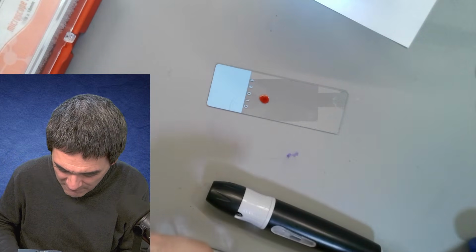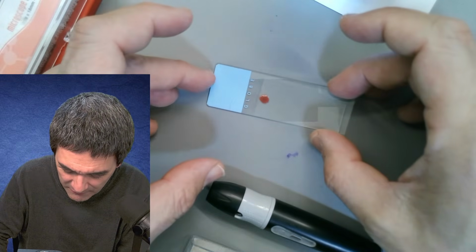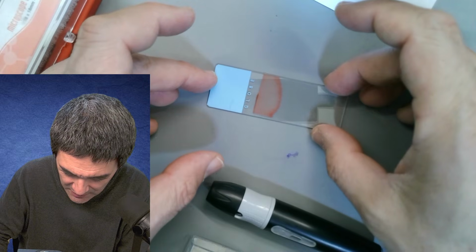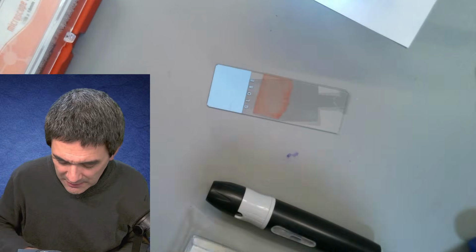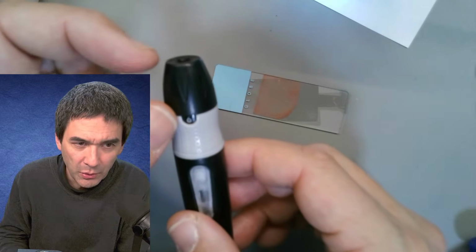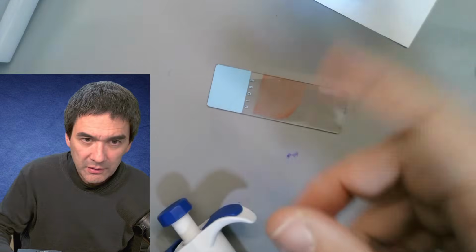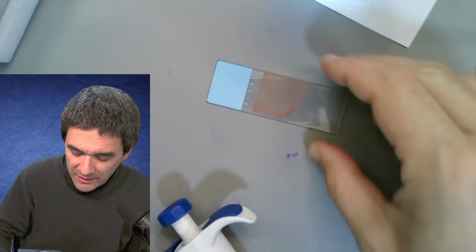I'm going to now use a very large cover glass because I want the blood to be spread very thinly. Okay. Just a single cell layer of blood. And we're going to look at it first using the normal microscope, so to say. Yeah, of course, I have to make sure I dispose of it then. Okay. I'm going to put it over there. And then we're going to put it under this USB microscope, and we're going to compare it a little bit. Okay, so this is kind of the idea. So here we go.